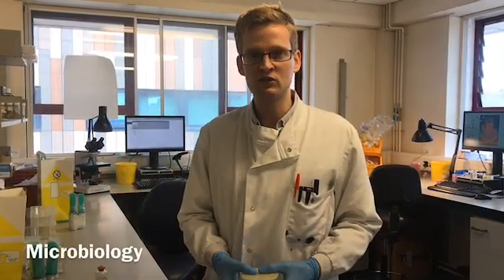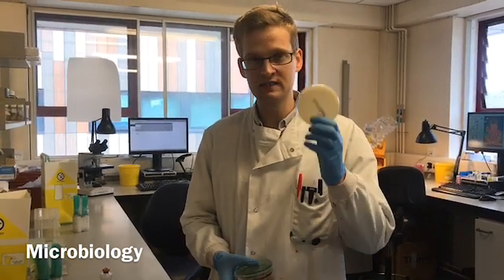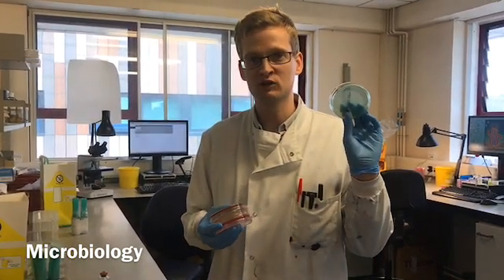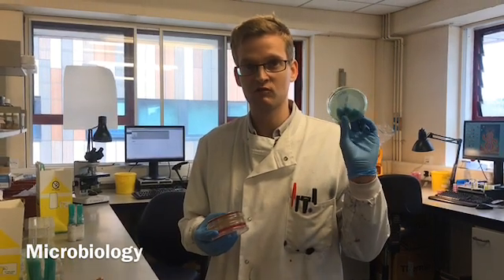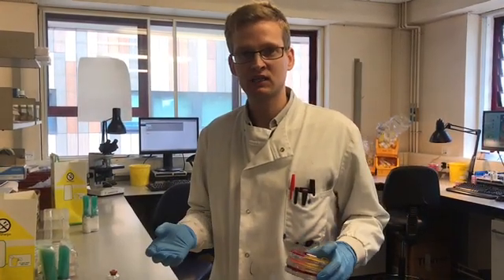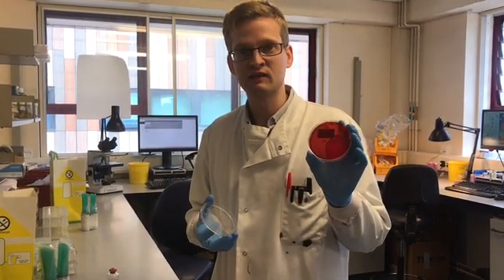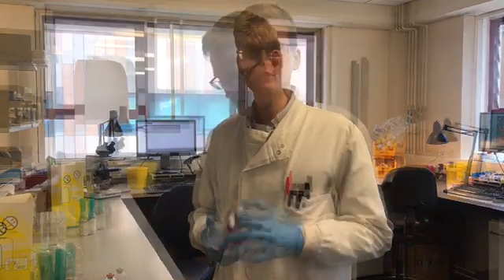The core technique we use in microbiology is culture. We typically use these agar plates. These are basically solid media and they contain high nutritional content for bacteria, and bacteria are quite happy to grow on these from our samples. The following day, we will take the cultures out of the incubator and hopefully our samples will have yielded some bacteria to test so we can identify it.